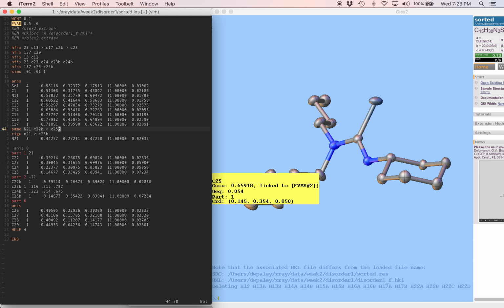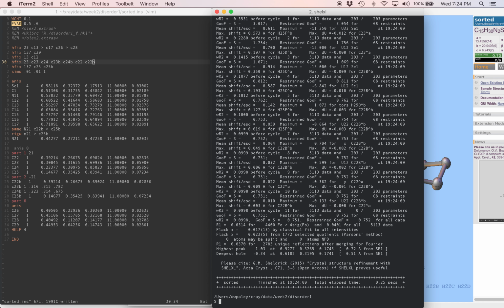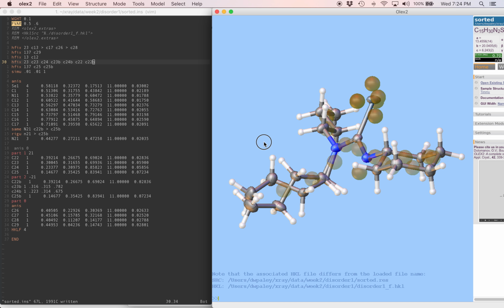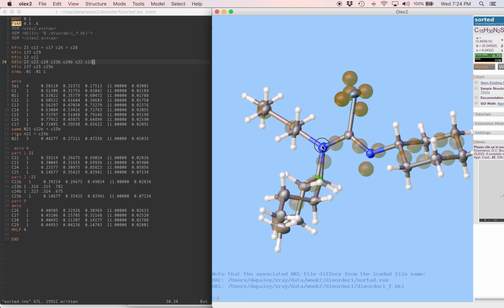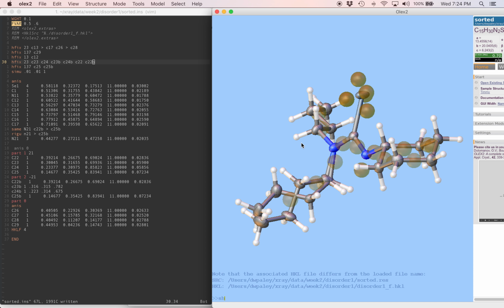All right, and the hfix instructions that we wrote at the top of the file, now we have 2 positions of C22, and we're going to hfix both of them. I'll save this, run the refinement. The R factor didn't change at all, but we're going to see what does the geometry look like in the result here. We can see that those 2 atoms did move apart naturally. They're 0.17 angstrom apart, which is a significant enough difference that we could believe those are 2 genuine disordered positions.